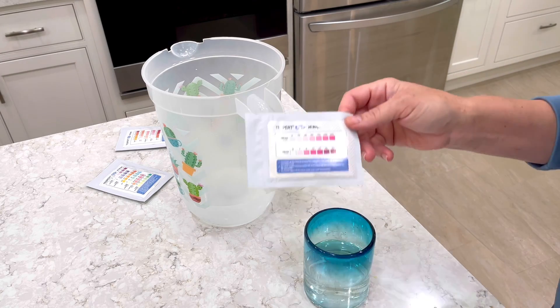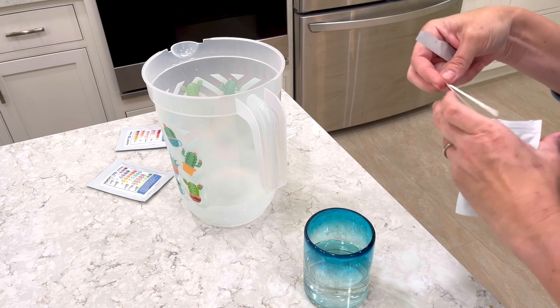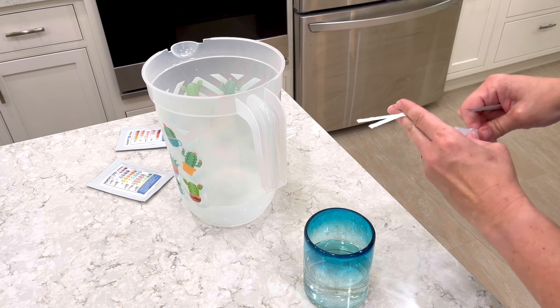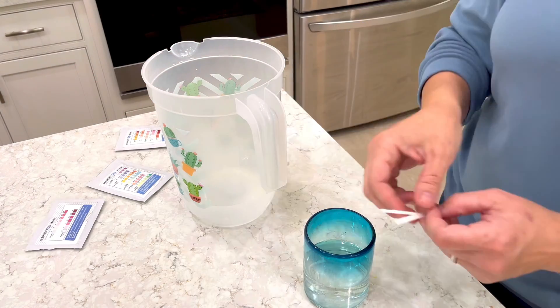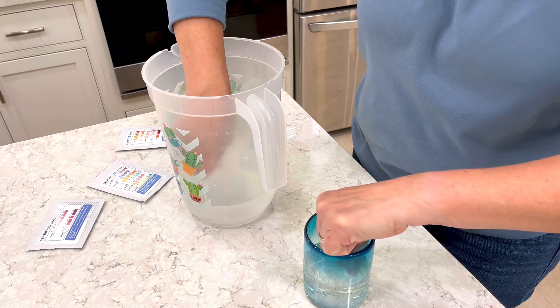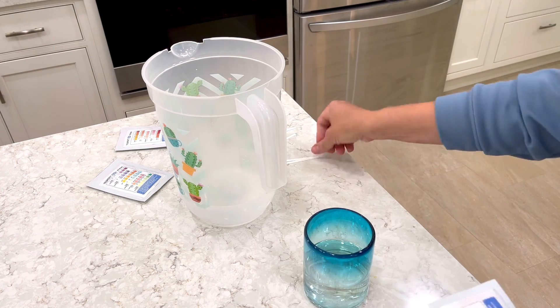I also did a quick test on my water supply for nitrites and nitrates. Supposedly if you have bad levels of those in your water it could lead to health problems, but my water was fine. The test strips were exactly the same for both water samples. So let's skip ahead to two days later when I show you the bacteria results.